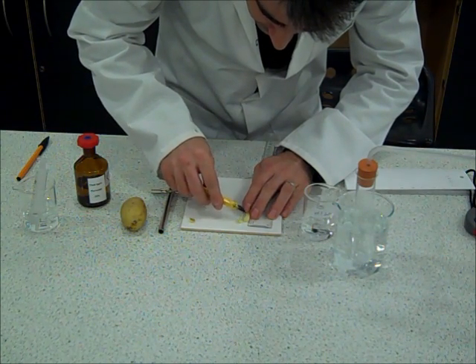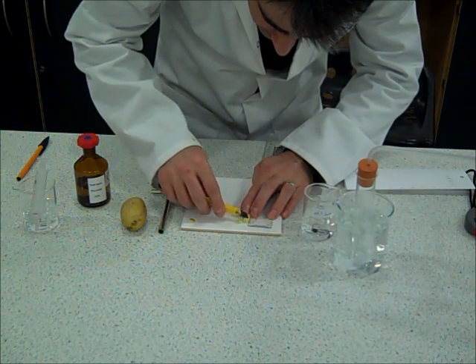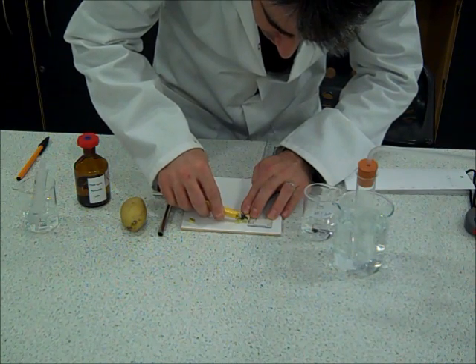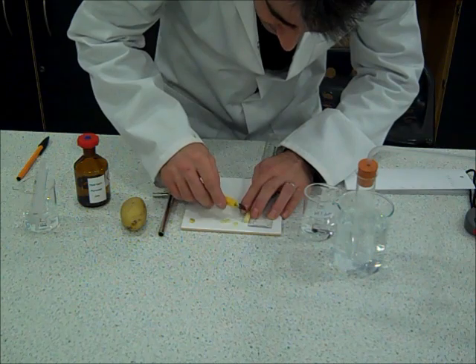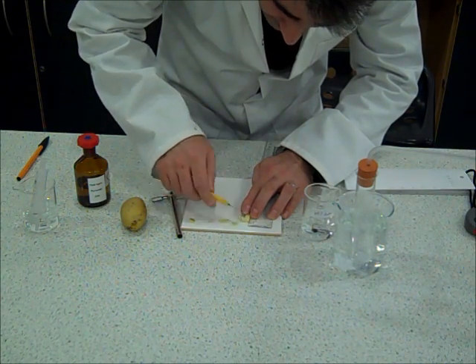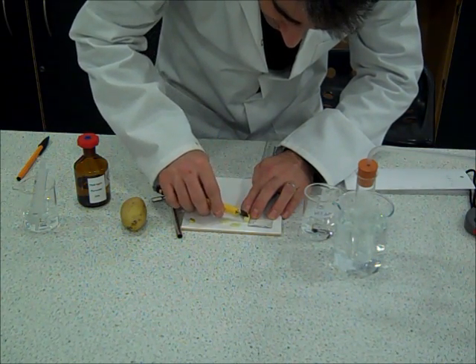In the first experiment I'm going to use 25 discs. After that I'm going to reduce the enzyme concentration by reducing the number of discs to 20, 15, 10 and 5.